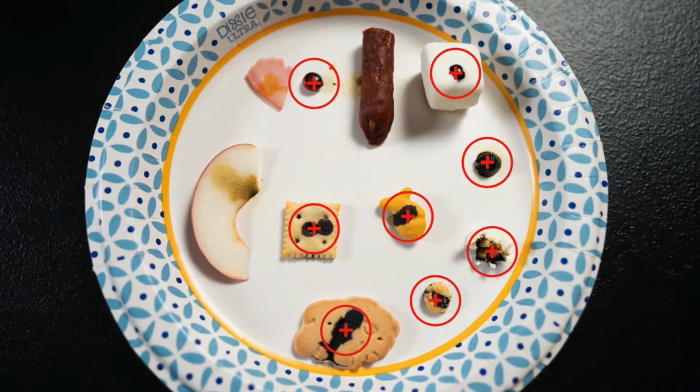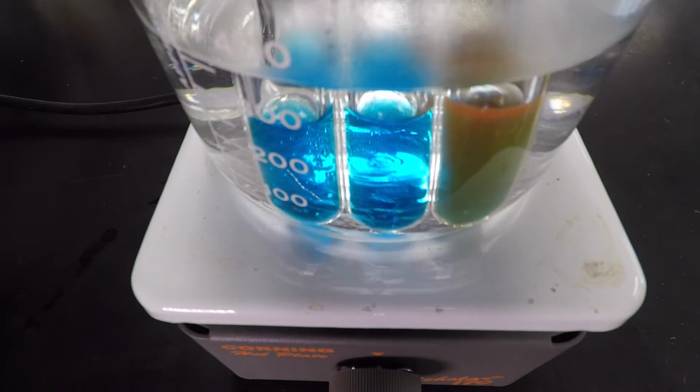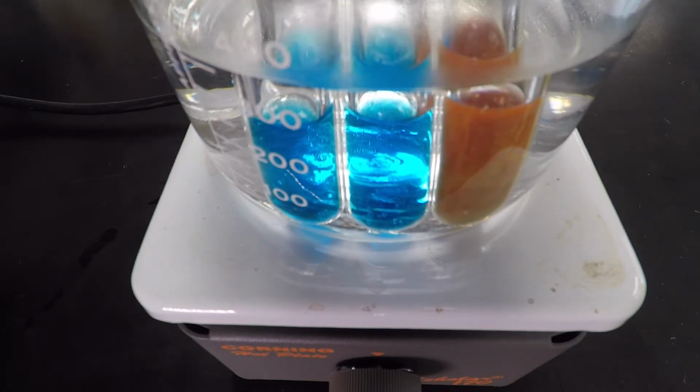The next two, not so scientific, but it's in the interest of time to try to get this lab completed within a reasonable hour. We could do a sugar test where we take the food item, put it into a test tube with Benedict's solution and heat it, but we're not doing that. Instead, we're gonna use the old sugar taster, which is your tongue. So we're just gonna eat the food, and we're gonna eat the food that is not covered in iodine, please. And if you taste something sweet, we will say that has sugar in it. Again, not super scientific, but that's fine for what we're dealing with here.